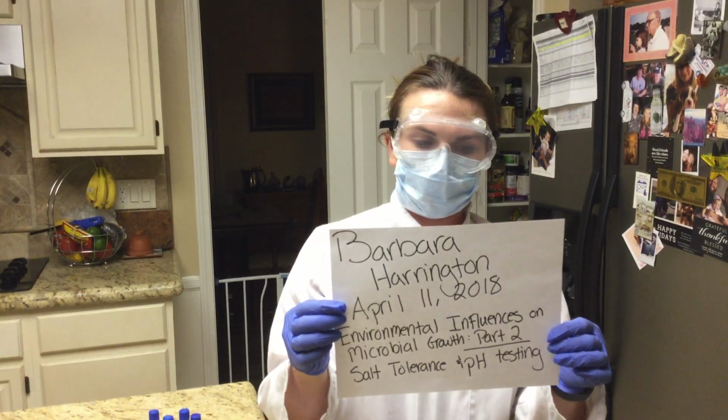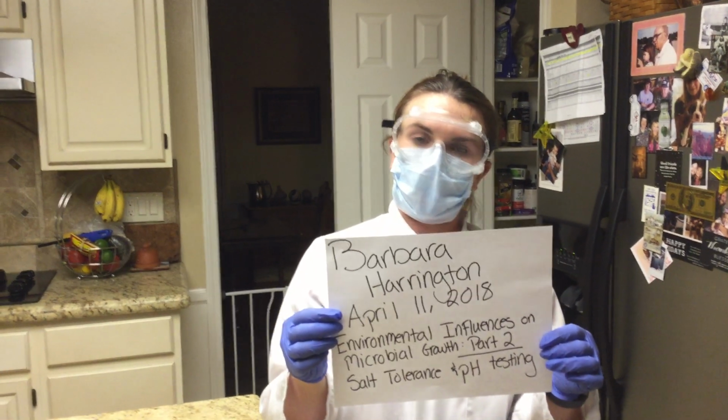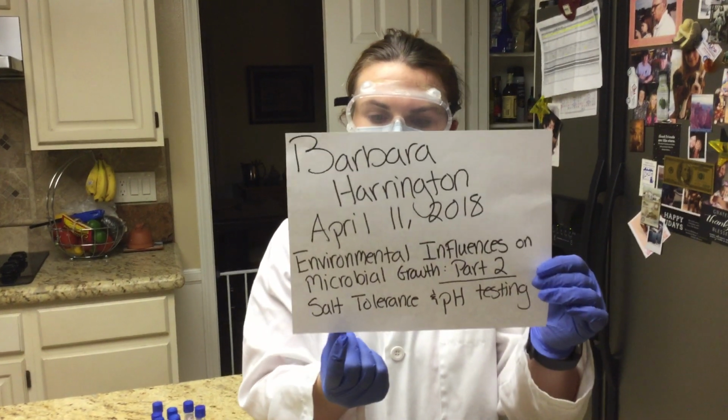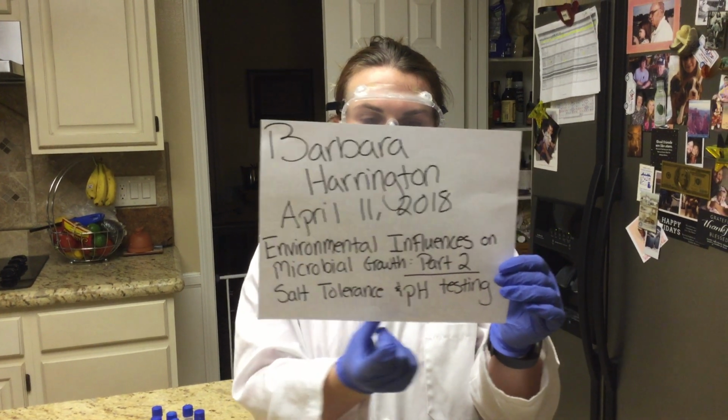We are doing environmental influences on microbial growth. This is part 2. It's been 48 hours since we inoculated our salt tolerance test tubes and our pH testing test tubes. So we're going to go check them out right now.